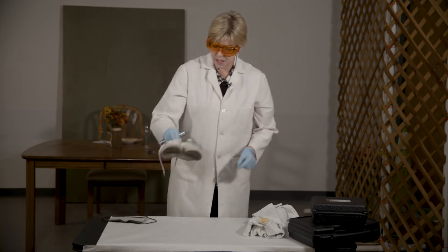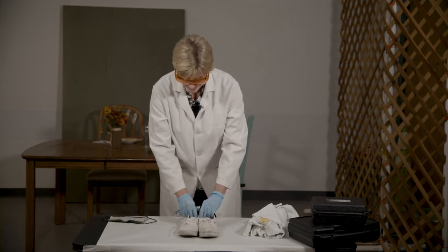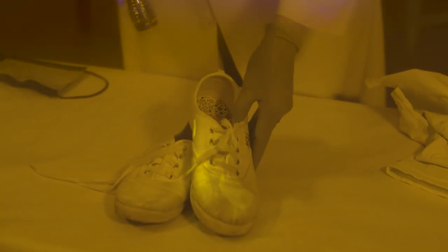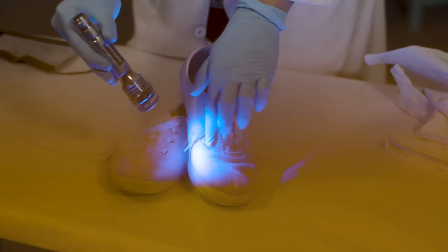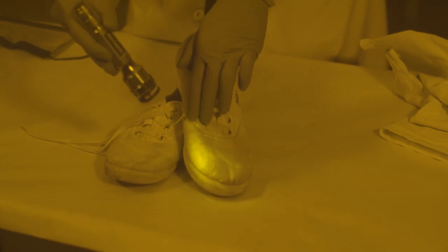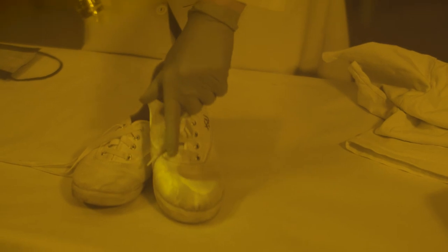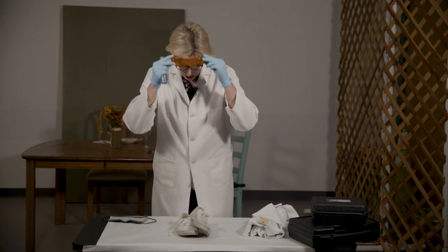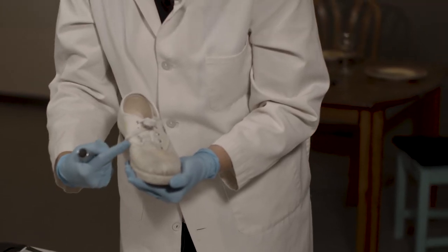We take a look at these shoes — normal shoes, nothing up my sleeve. Looking at these, they are also fluorescing. Again, perhaps this is not biological fluid. We can also see here that there could be some element of a pattern present when we look at it with the alternate light source. Turning the light source off and looking at it with just our naked eye, we're not seeing that same level of detail.